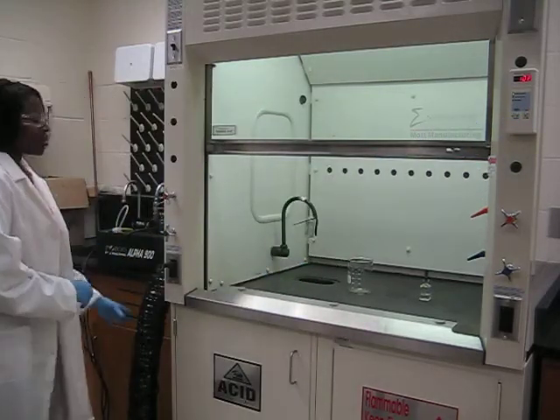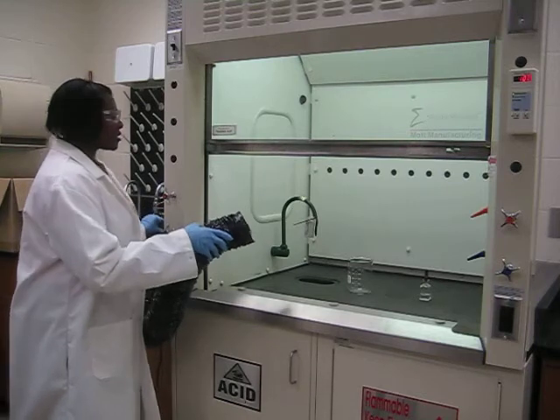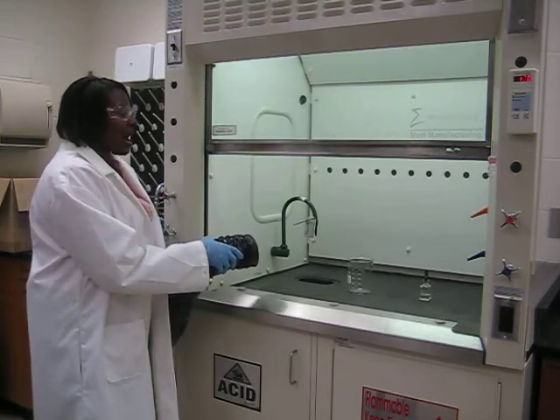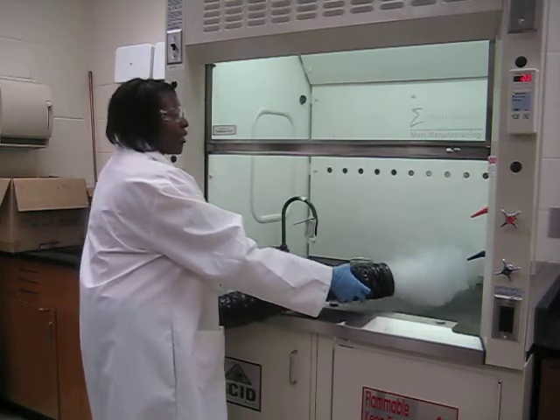This is the fog machine that I use when I'm testing the fume hoods. It allows me to see exactly how the air is flowing through the fume hood. So it's very important when using the fume hood that you keep items 6 inches from the opening of the hood and elevate it if necessary to make sure that the fume hood is operating properly.